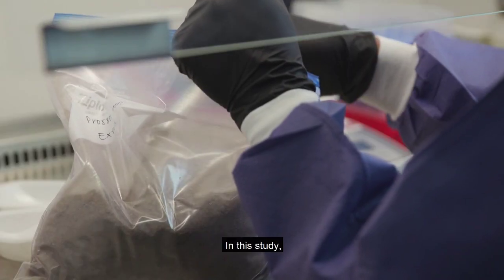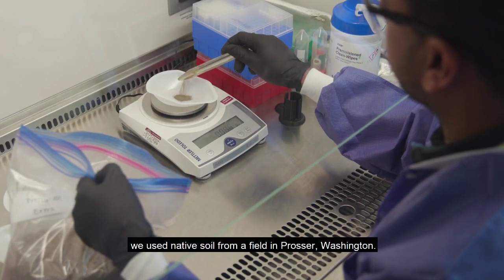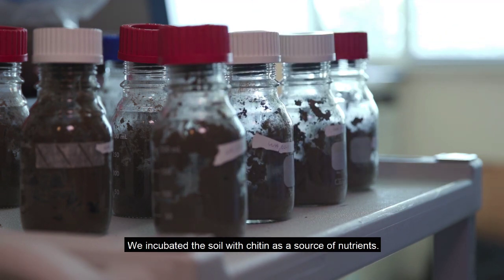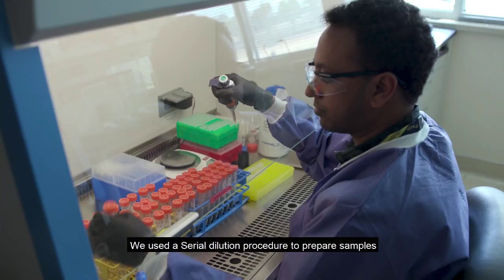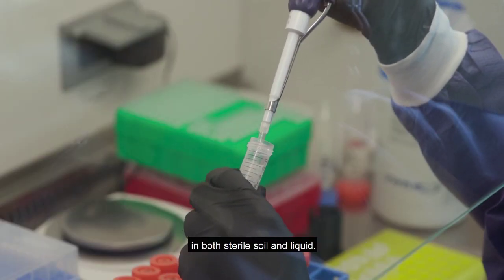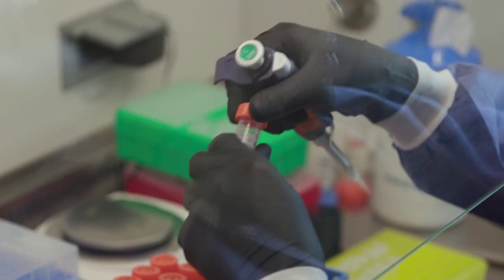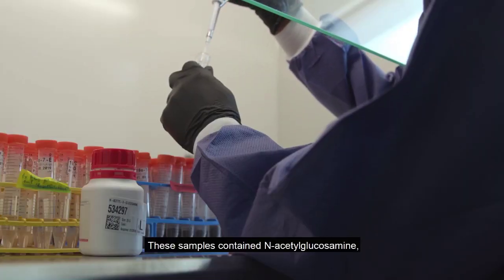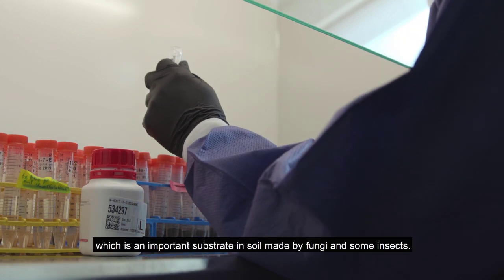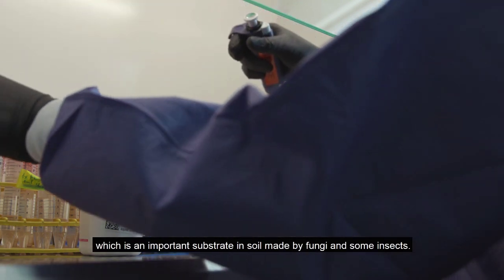In this study, we used native soil from a field in Prosser, Washington. We incubated the soil with chitin as a source of nutrients. We used a serial dilution procedure to prepare samples in both sterile soil and liquid. These samples contained acetyl glucosamine, a monomer from chitin, which is an important substrate in soil made by fungi and some insects.